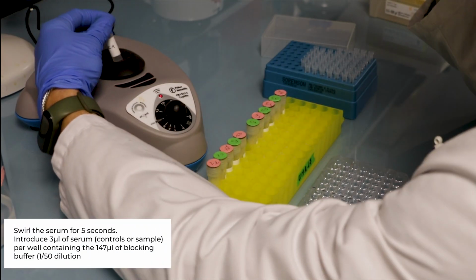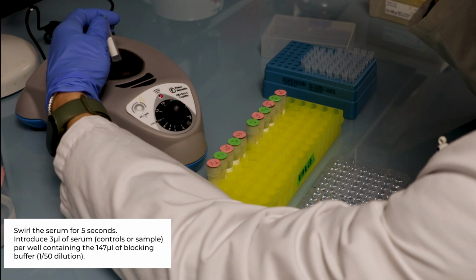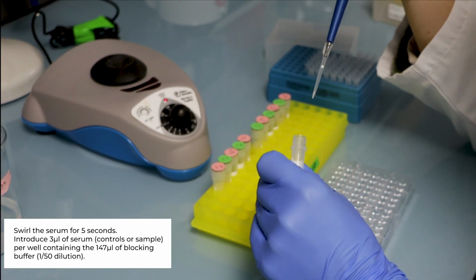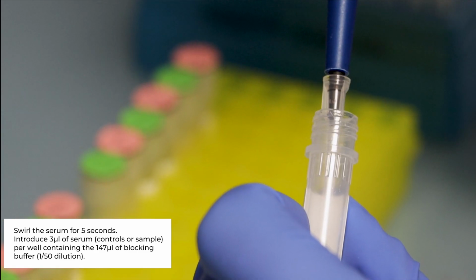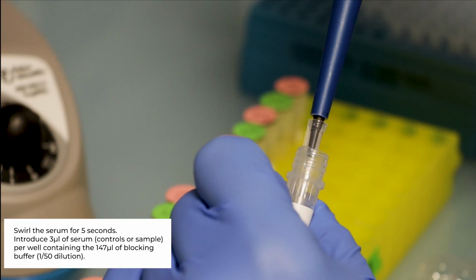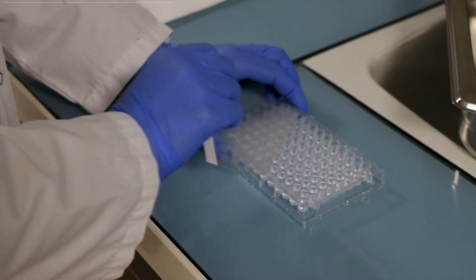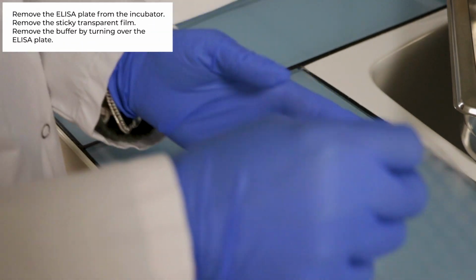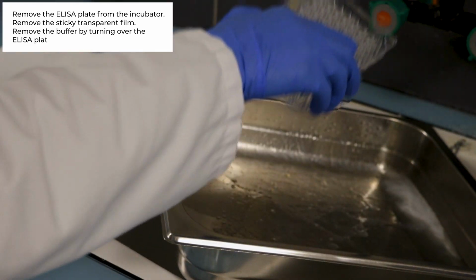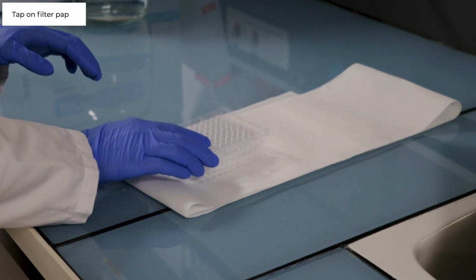Vortex the serum samples before pipetting. Introduce 3 microliter of serum, either control or sample, per well containing the 147 microliter of blocking buffer. The dilution is 1 in 50. Remove the ELISA plate from the incubator, remove the sticky transparent film and discard the buffer by turning over the ELISA plate. Bang on absorbing paper.